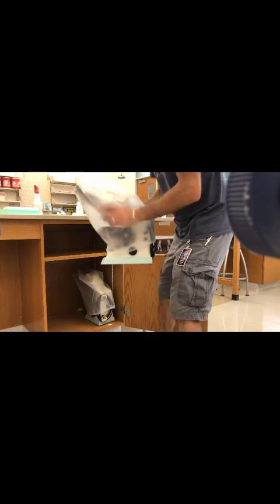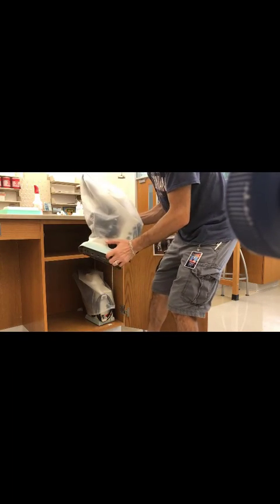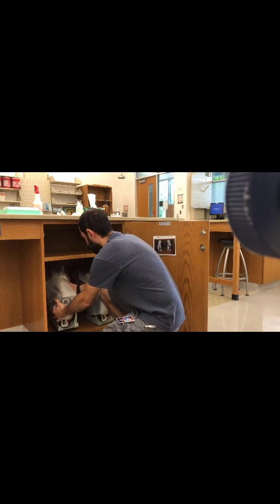And the proper way to put it away, remember, is with the ocular, the eyepiece pointing away. Notice how the eyepiece is away. I place it carefully, close the cabinet, and I'm done.